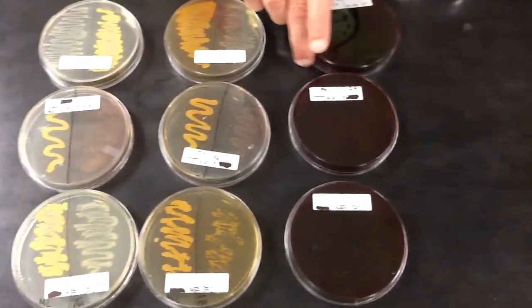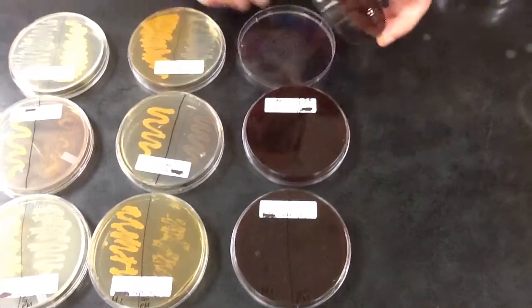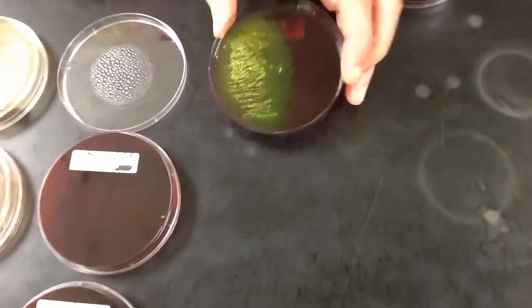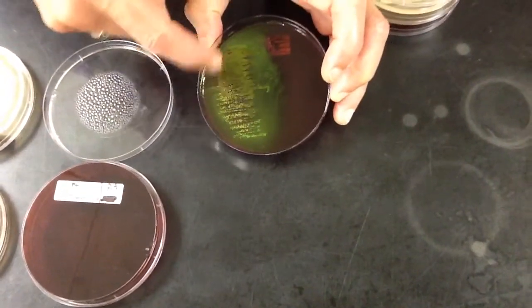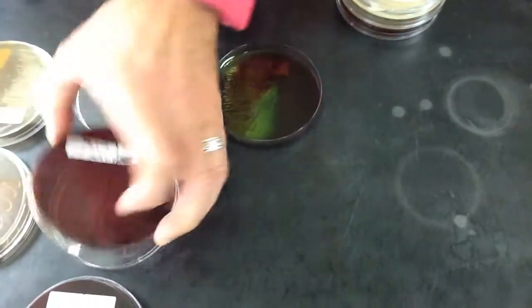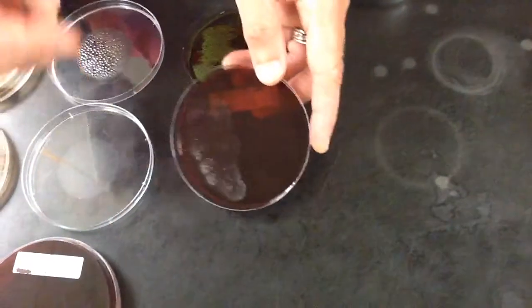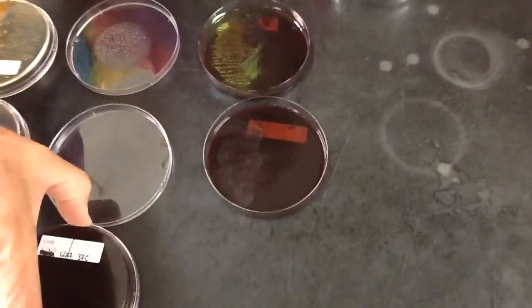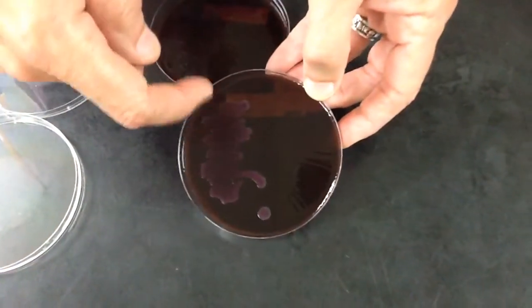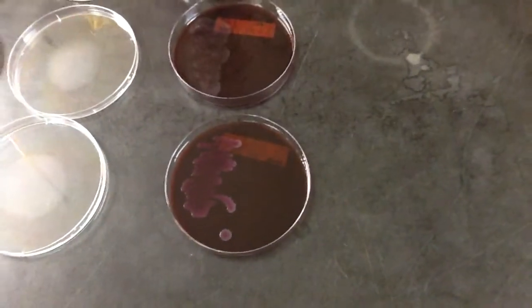Now at the EMB, the difference is that it will inhibit gram-positive. Another cool feature of that — if you take a look, you can see a green sheen here, which shows this bacteria is a strong fermenter. If you look at this one, it kind of blends in — that's a non-fermenter. And down here is a low to moderate fermenter; you can see the pink and purple.